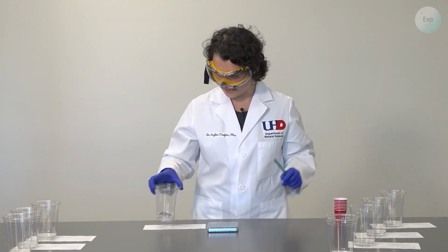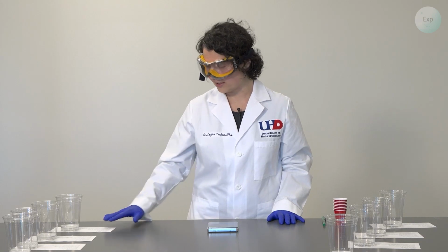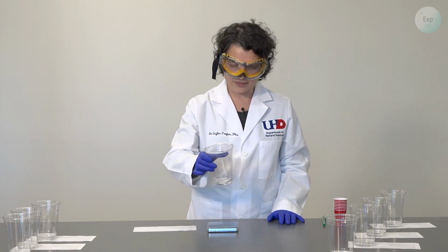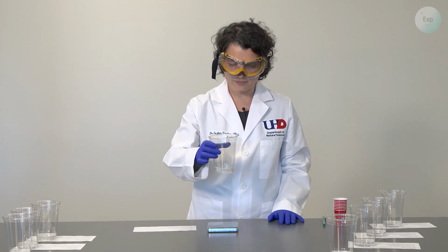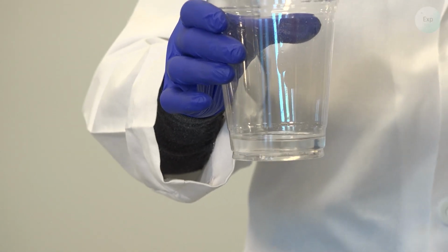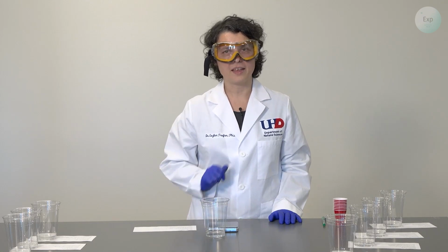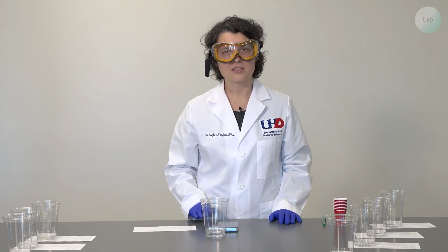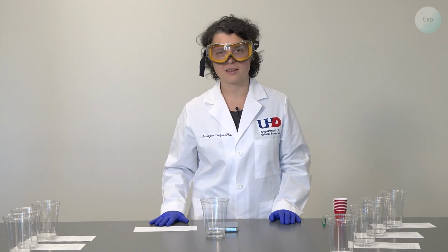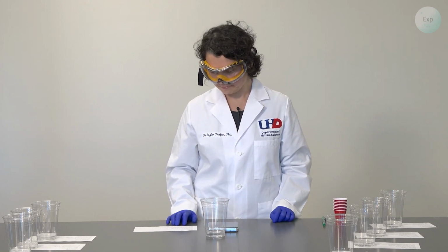Now, there are a couple things that we need to consider as we complete our data collection here. The first thing is, when we look inside the cup, we're going to see some white, fluffy solid that is not dissolved. If you read the contents of your Alka-Seltzer tablet, you should be able to identify what that ingredient is. And that has no impact on the experiment because it is a non-reactive ingredient. So it will be considered a spectator compound.